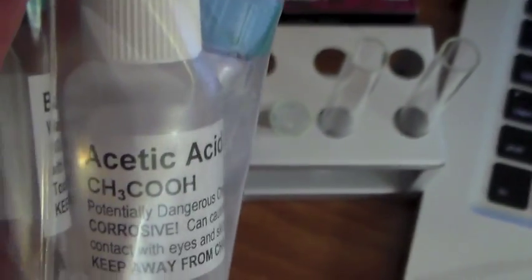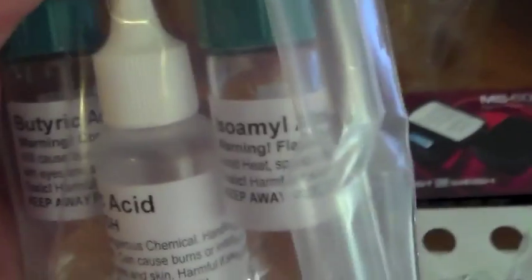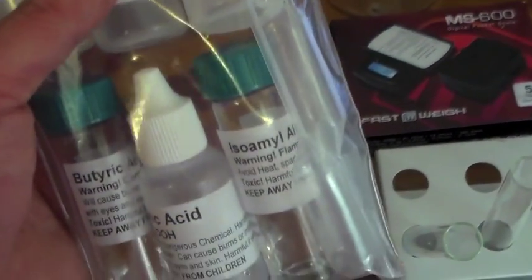And we have acetic acid with a few pipettes in there.